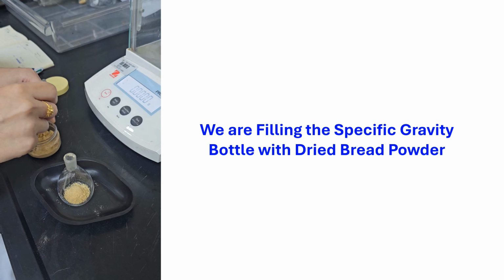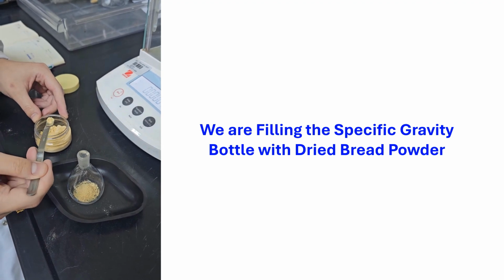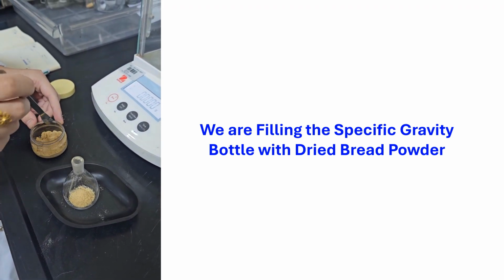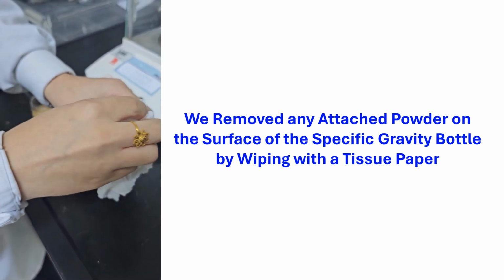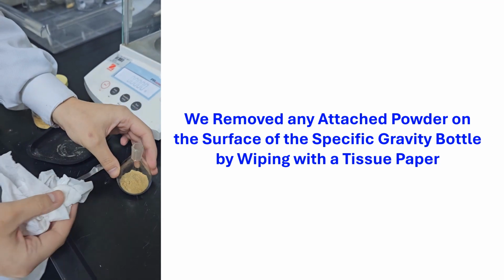We are filling the specific gravity bottle with dried powder. We removed any attached powder on the surface of the specific gravity bottle by wiping with a tissue paper.